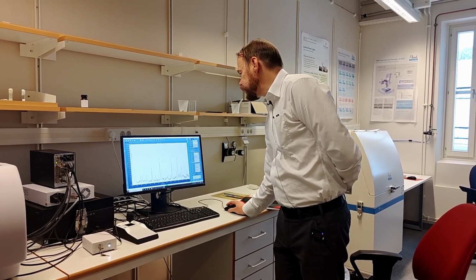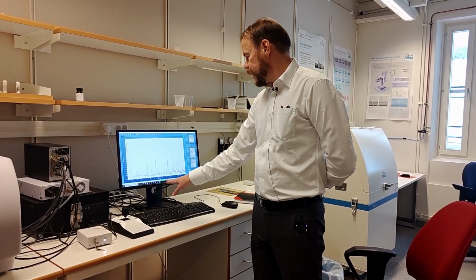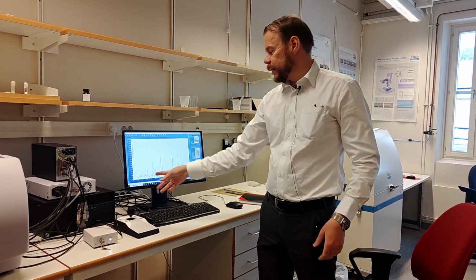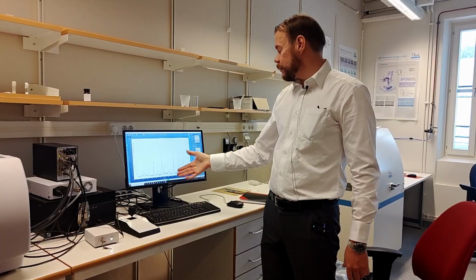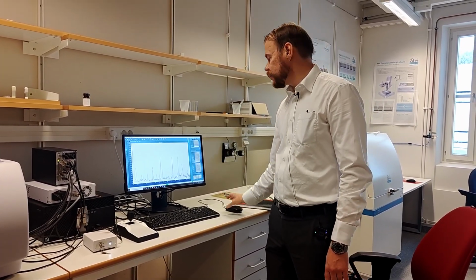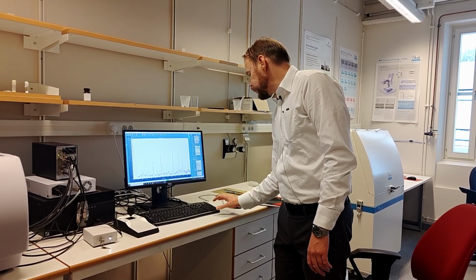It can be worth mentioning, if you go back to the acquisition tab, as I said, this 1800 grating has a smaller view field in wavelength range, right? So if I want to scan longer, more than 1500, I want to scan up to 3000. Let's say I do that. I write 3000 here.